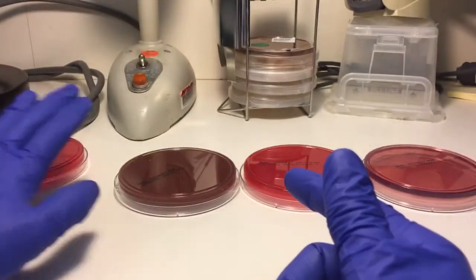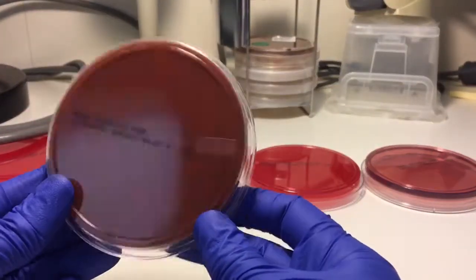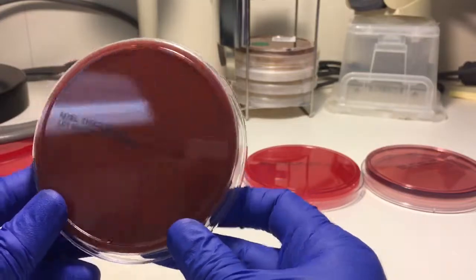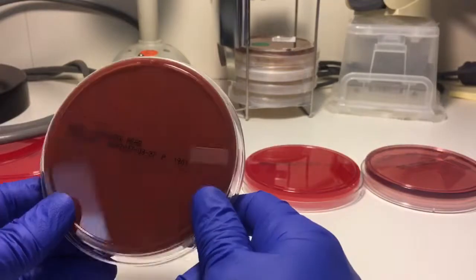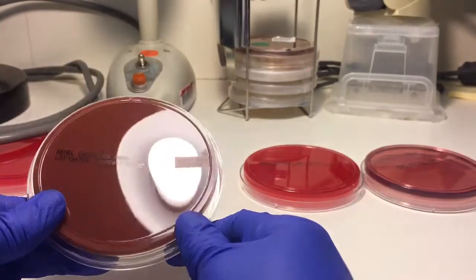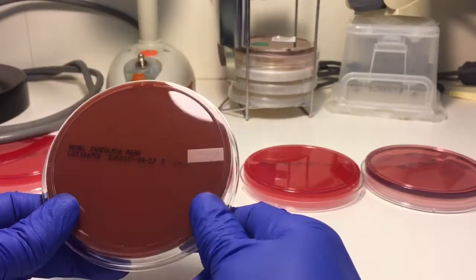This is the chocolate agar plate — it is not actually made of chocolate, don't be silly. It is made of 1% hemoglobin and supplements. There are no antibiotics in it, so it should grow everything like gram positive and gram negative, but it will also grow out fastidious organisms like Haemophilus. It's very useful and we use it a lot in the micro lab.